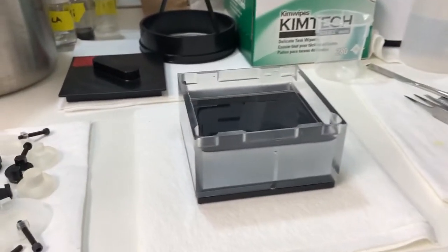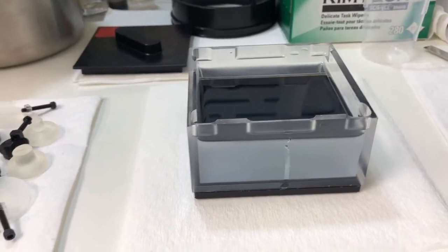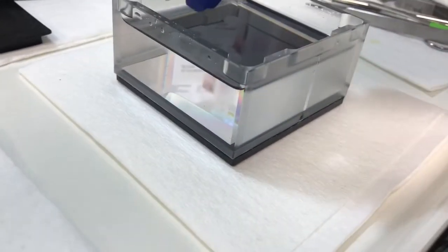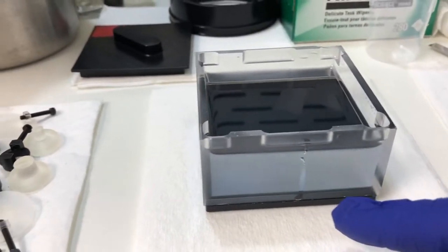The cuvette is now in the fume hood and you can see a few things. First of all, this is in pretty good shape in the sense that there haven't been a lot of spills. There's just a little bit of DBE here on the top maybe, and this is the only big smear that we have.